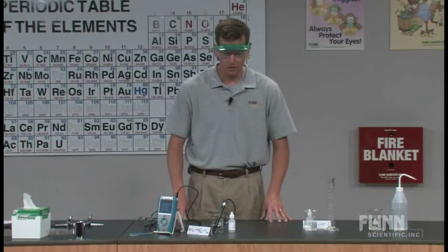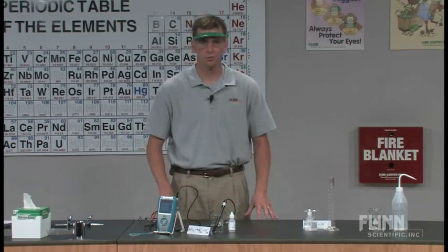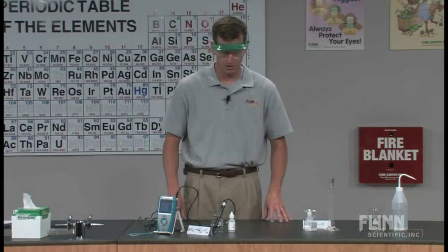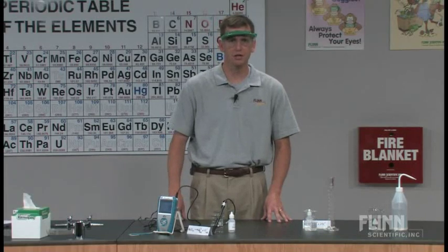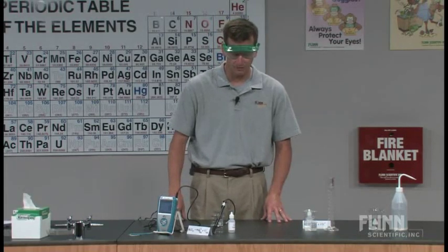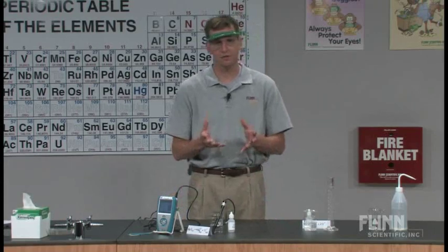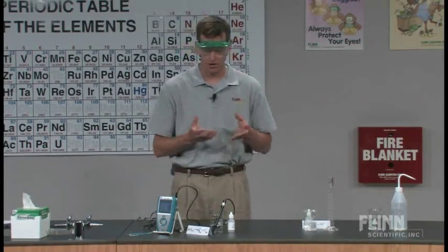We're going to take two relatively well-known, well-used solids, sodium chloride and calcium chloride. We're going to dissolve them in about 70 milliliters of water, and then we're going to see their effect of concentration on the current.